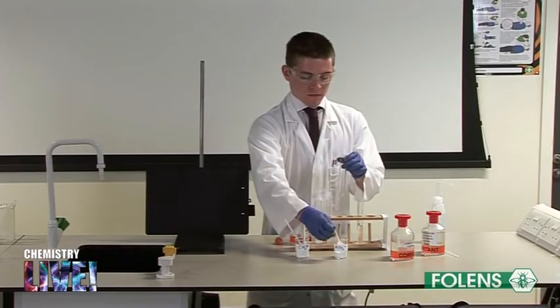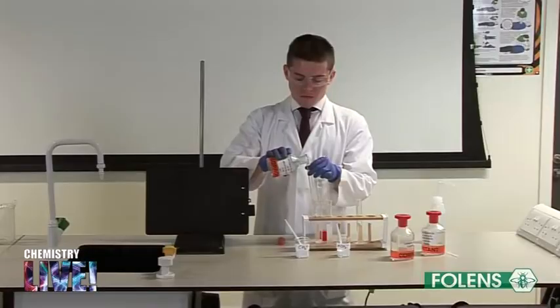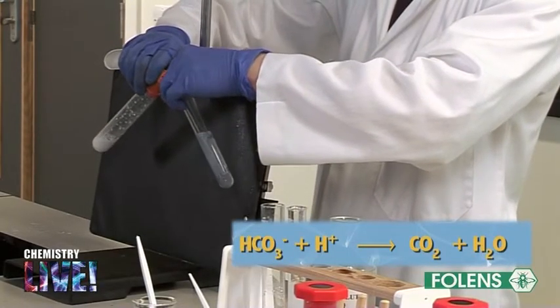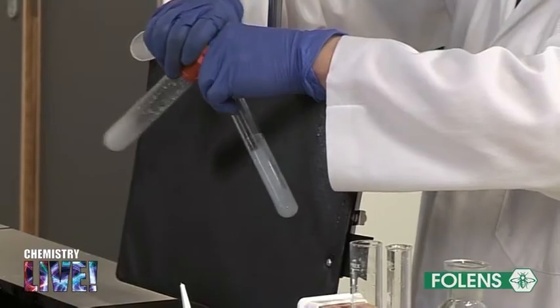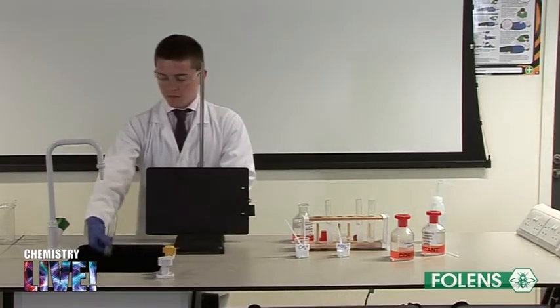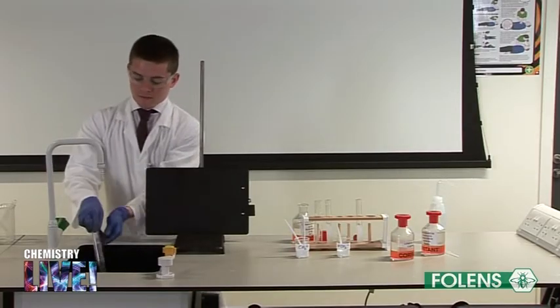Repeat the experiment using hydrogen carbonate salt instead of carbonate salt. As in the case of the carbonate, the hydrogen carbonate reacts with the acid to give off carbon dioxide. We have seen both a carbonate and a hydrogen carbonate react with dilute acids to give off carbon dioxide. Since both carbonates and hydrogen carbonates react in a similar way with dilute acids, we must have some method of distinguishing between the two ions.